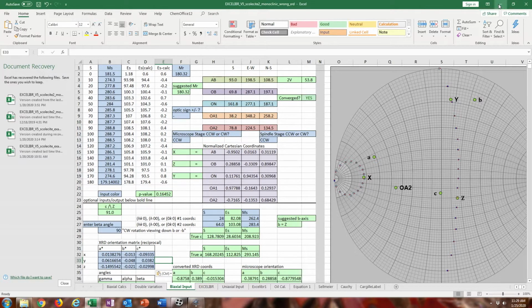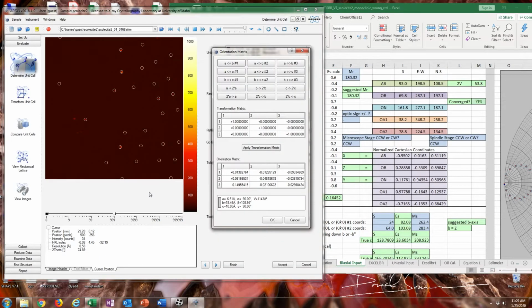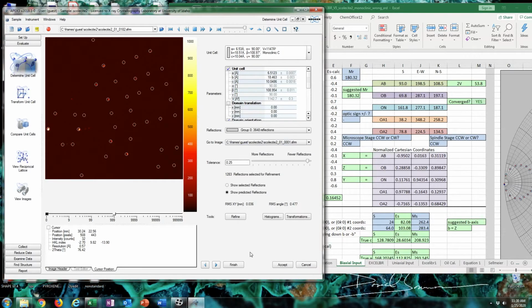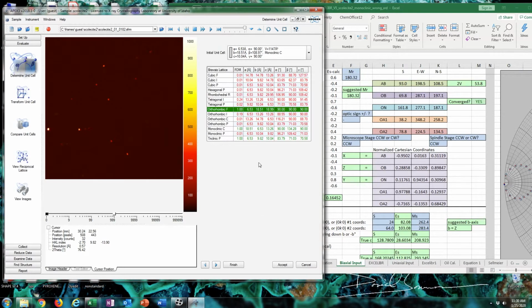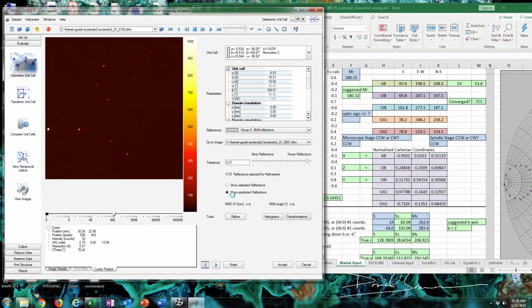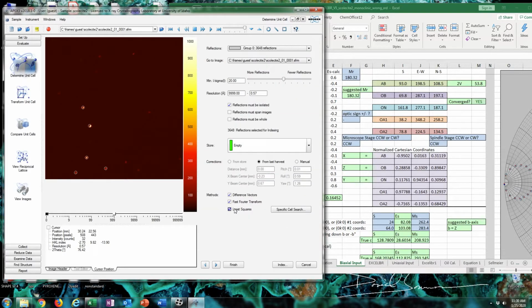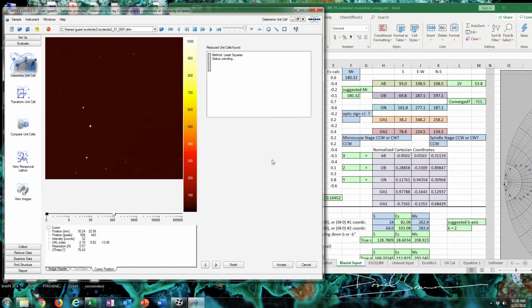Yeah, so this setting doesn't work at all either. What's wrong with this one is it looks great on the XRD, on the X-ray information here. But for whatever reason, for the lattice that this picked, none of the crystallographic vectors correspond with the optical vectors. And we're quite sure that it's supposed to be monoclinic. So that means that it can't be the setting either. If A, B, and C, none of those correspond with X, Y, or Z, no way that is monoclinic.